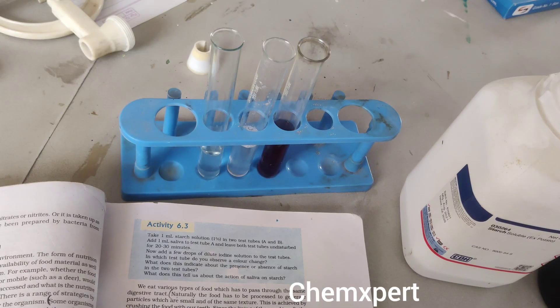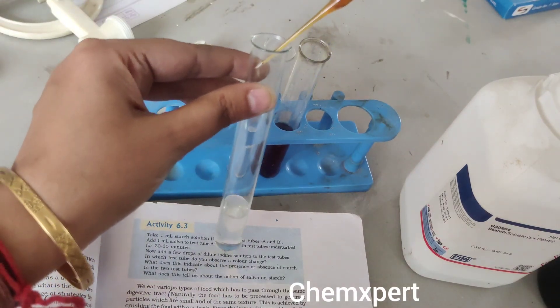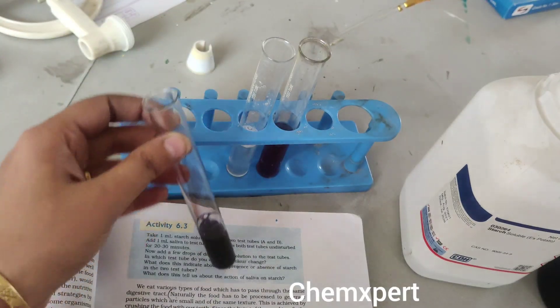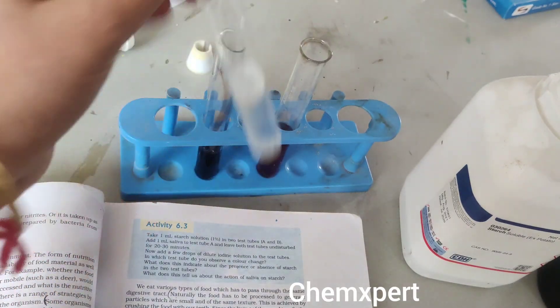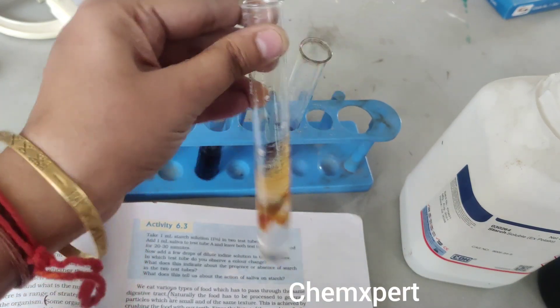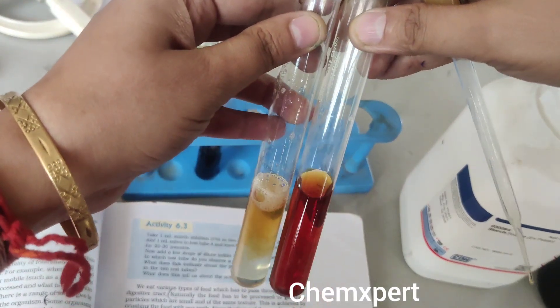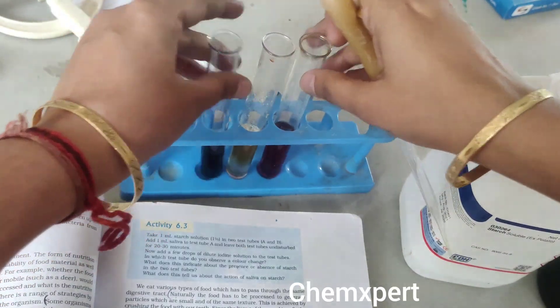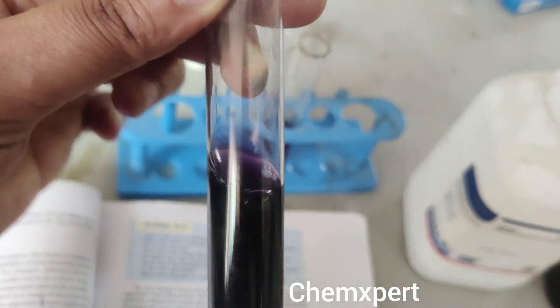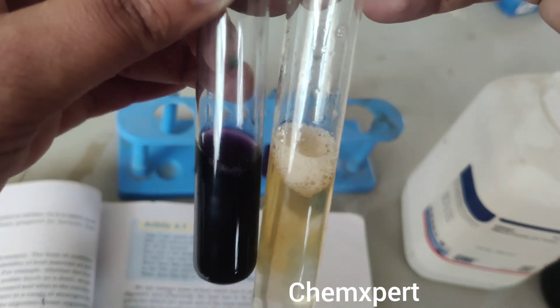One hour later: when we add a few drops of iodine solution into the test tube containing only starch, it converts into a purple color solution, as you can observe here. Whereas in the case of the test tube containing starch and saliva, you can observe the color remains the same — just like the dilute iodine solution we prepared. The starch-only test tube turns violet or purple, while the test tube containing starch and saliva does not change color.